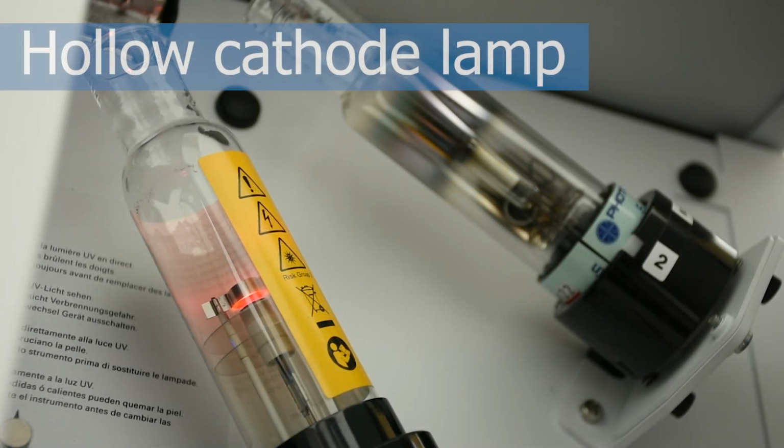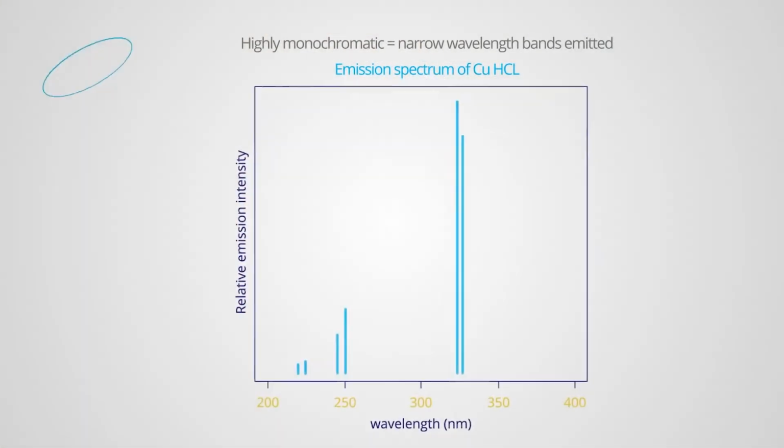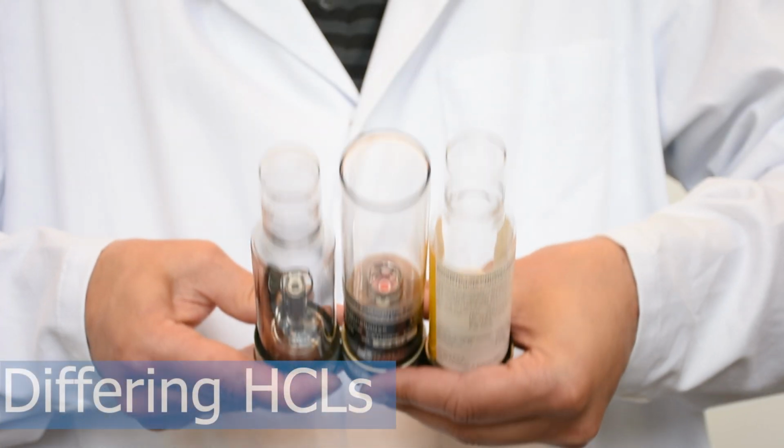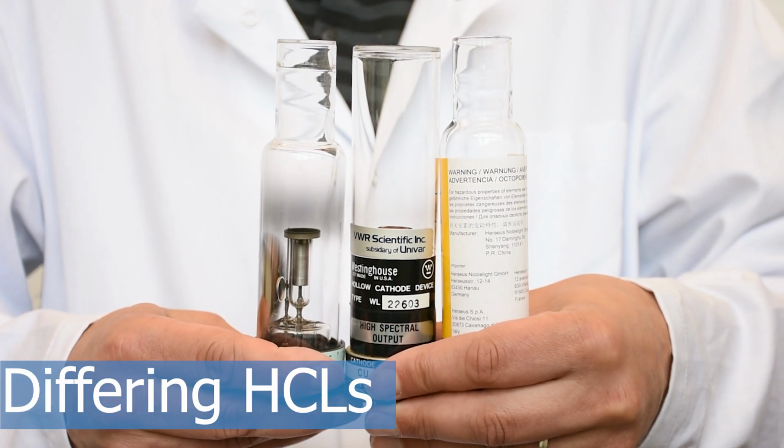The light source in this instrument is a hollow cathode lamp, or HCL, which is a source of highly monochromatic light. Each lamp is specific to a certain metal, so if you analyze more than one metal, different HCLs are required.